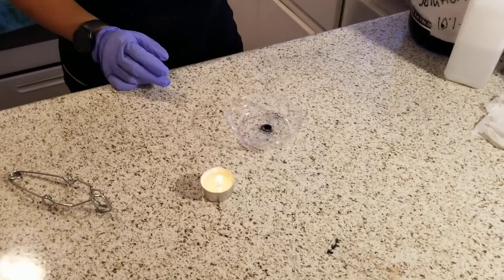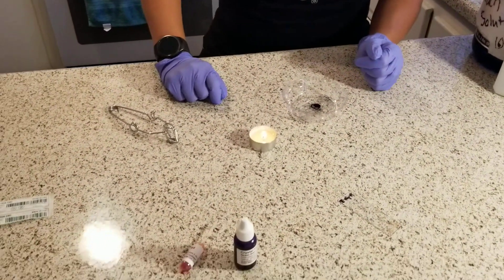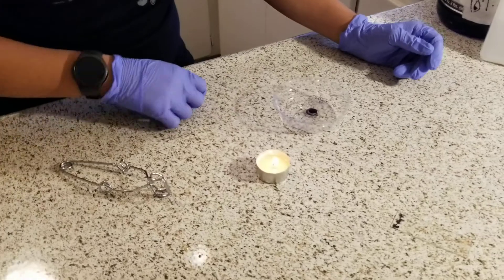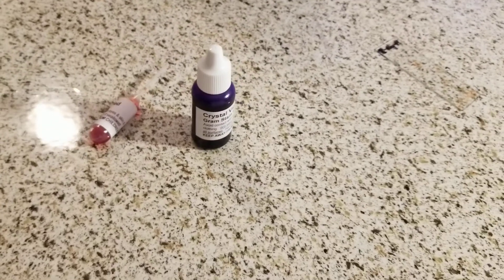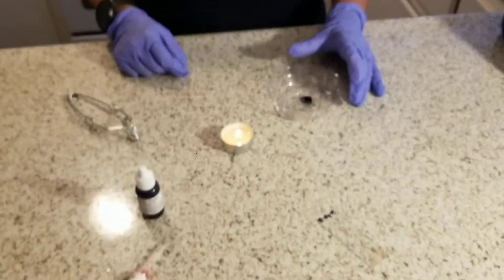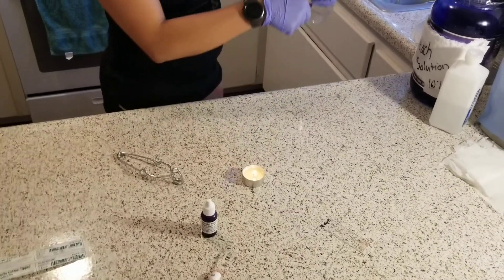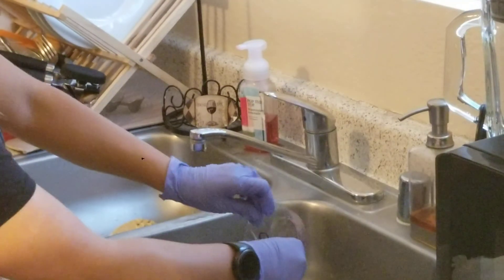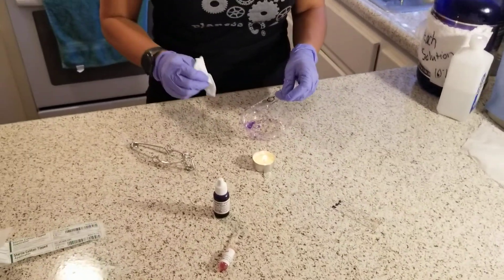After the 60 seconds, I'm going to rinse it. I'll wait about 16 seconds, then rinse it until the liquid runs clear. Then I will take my slide and run it under tap water until it runs clear. Then I'm going to blot it with paper — just gently blot it around.